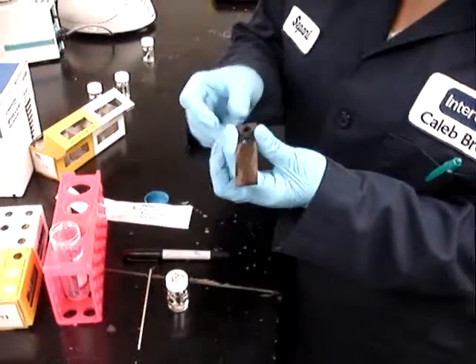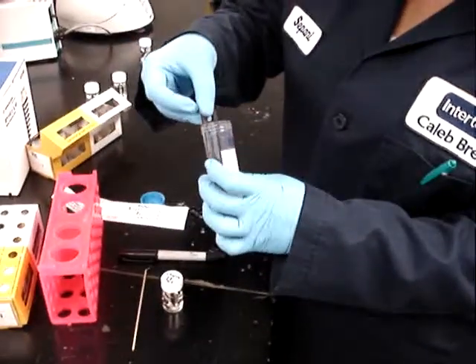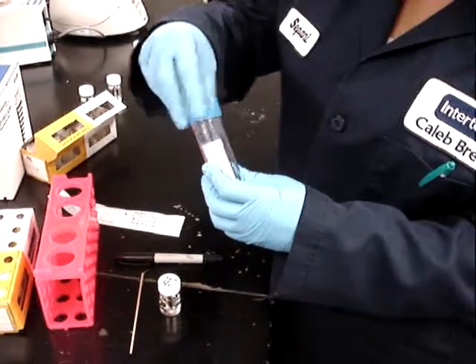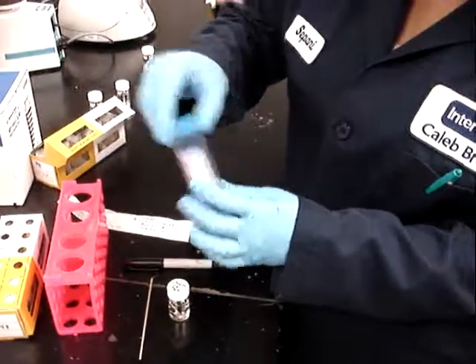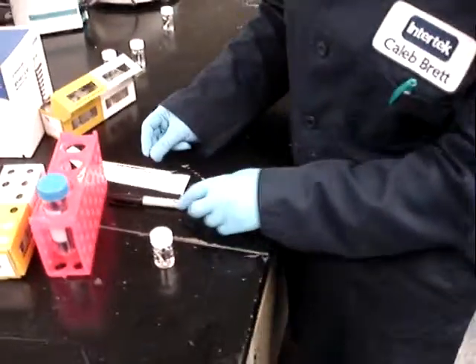You can see that if a coupon pulling crew were to try to sample like this, it's very simple, it doesn't take much time, it doesn't take too many materials. So it's pretty fast, pretty convenient.